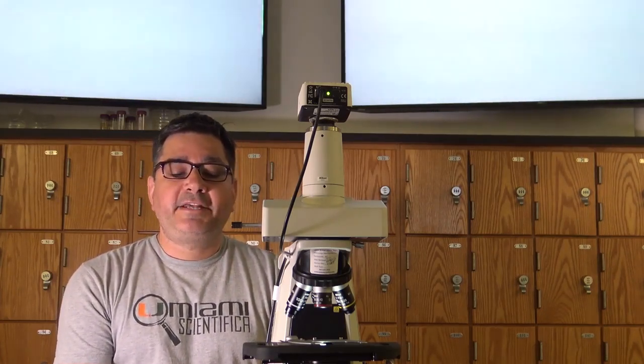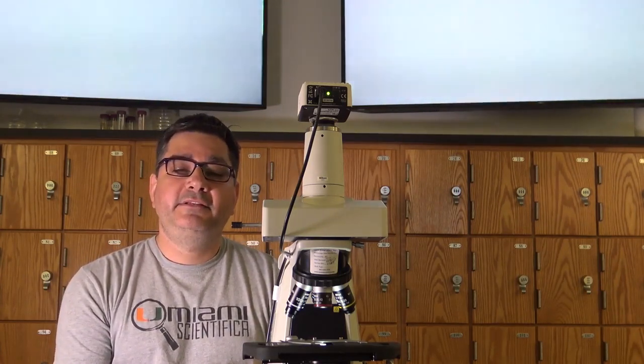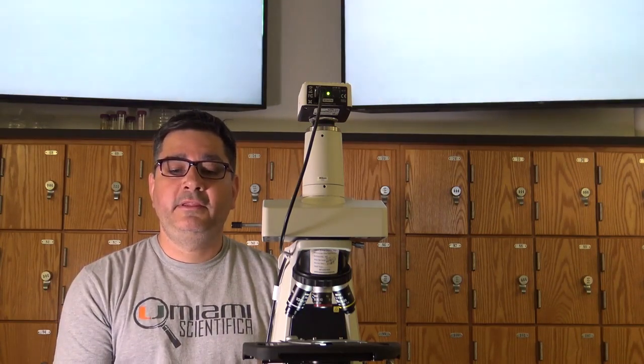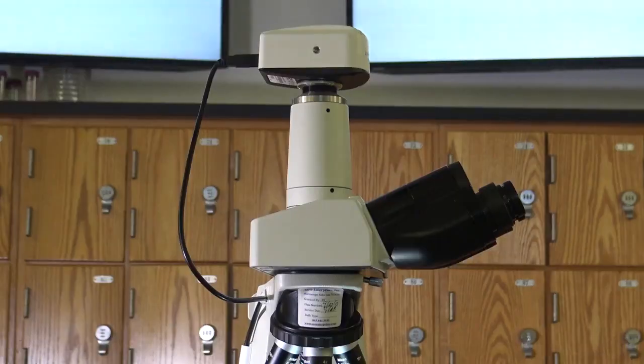Please put aside your past training with the microscope, as you will need to follow precisely the methods which will be described. To begin, let's discuss and point out the important parts of this microscope. The microscope head houses the eyepieces and may be of the trinocular variety.